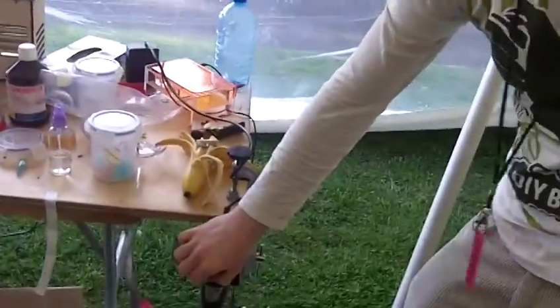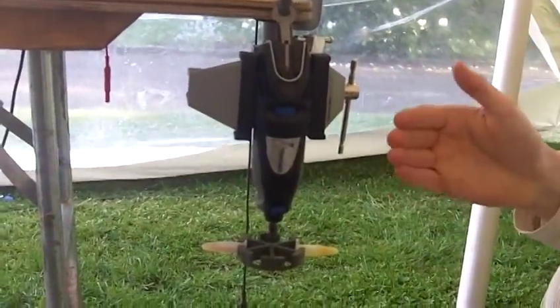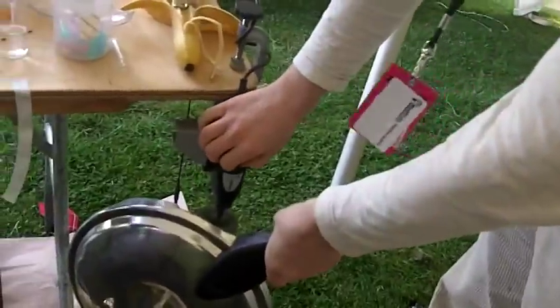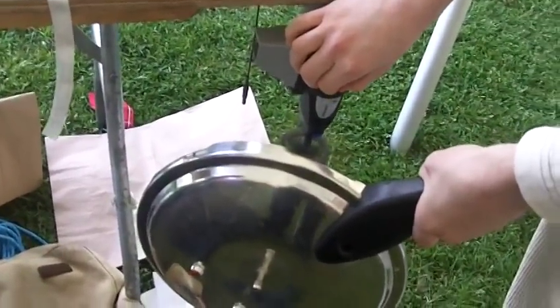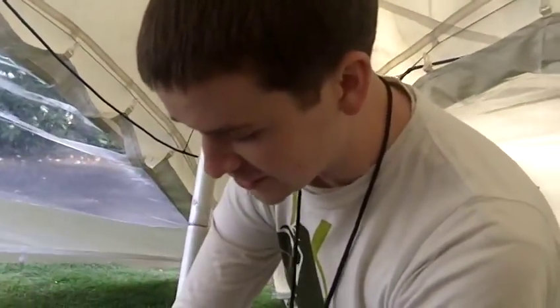The Dremel is the kind of thing you'd have lying around your hackerspace anyway. What I'm going to do now is — after allowing the enzyme to chew away for a while — centrifuge this down to separate all the solids from the liquid which contains the DNA. By centrifuging, I can remove contaminating solid and just get the liquid. I'm going to cover it, just in case — I don't believe in collateral damage. Other people avoid the risk by standing outside the plane of rotation. With the newer version of the Dremelfuge I haven't had any ejections occur, so I'm pretty confident.